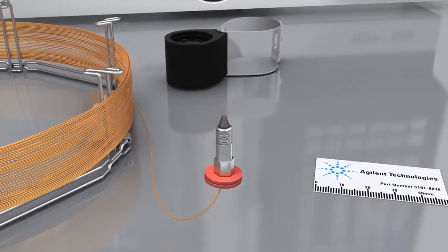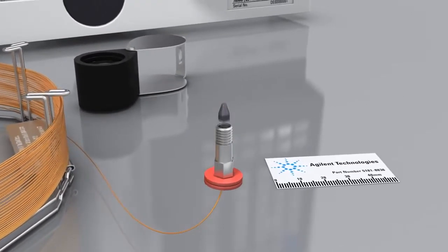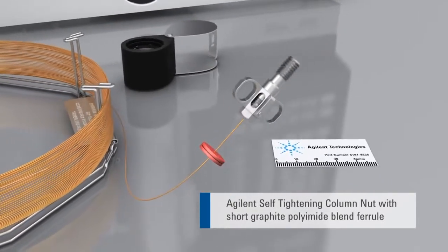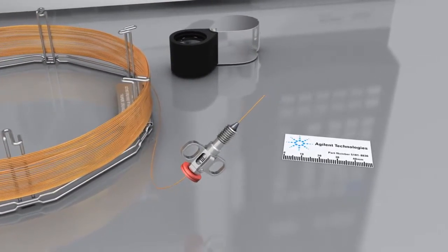Graphite polyimide blend ferrules are very popular, but are known to leak after temperature cycles due to ferrule shrinkage. Innovative self-tightening column nuts keep the seal from leaking following thermal cycling. There is no need to retighten fittings to fix leaks caused by the ferrule shrinking.